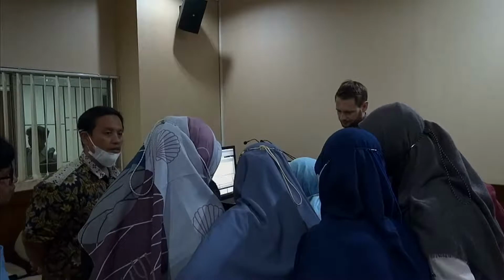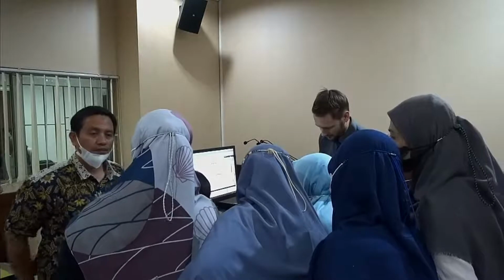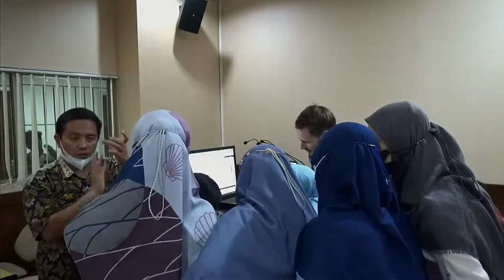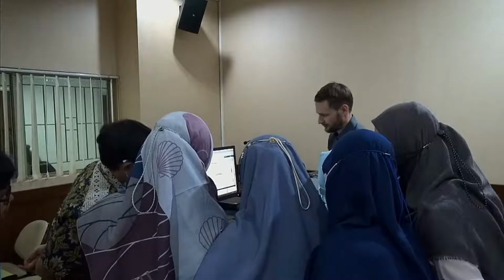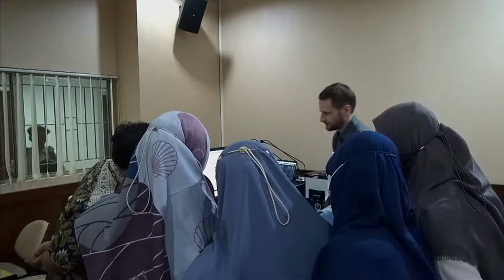You can directly see here beam obscuration rising, so now we see, okay, it's not really close to 10%. We always start conservatively, so let's add a little bit more. Let's wait a little until it reaches the cell. And now we are in the area of 10%. So I'd say, okay, it's good.